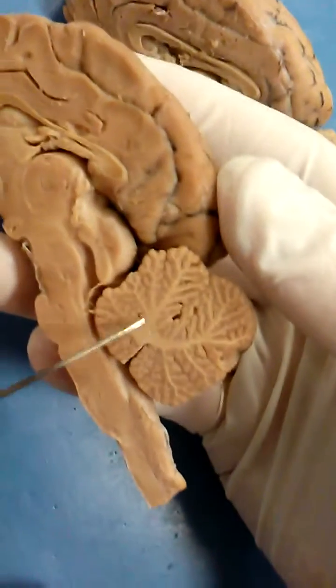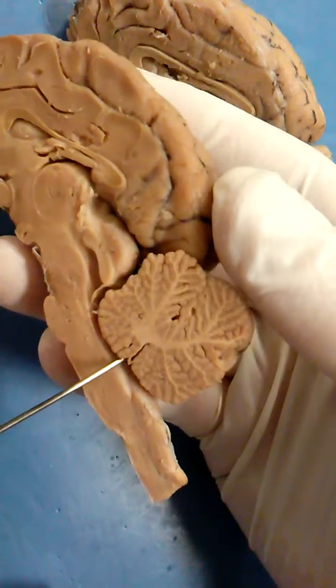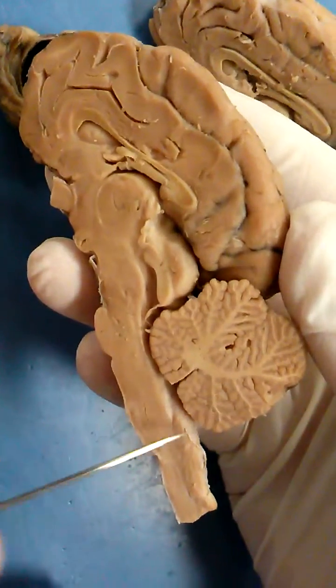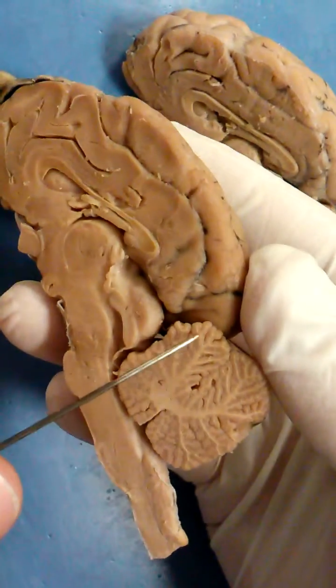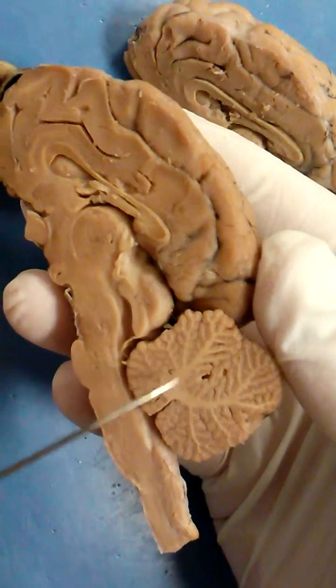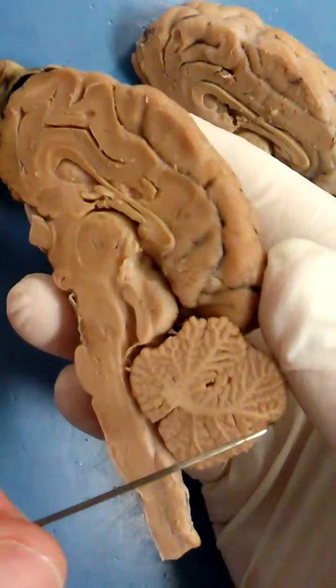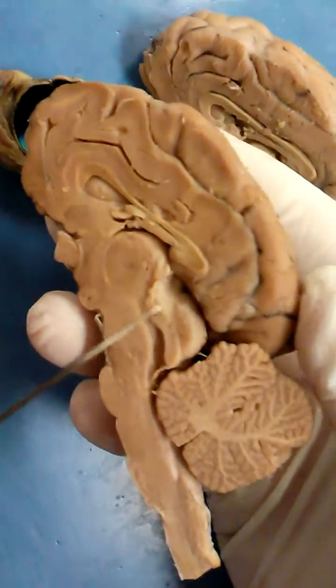This is the cerebellum — little brain. These branching things are called the arborvitae. It means 'tree of life' in Latin.